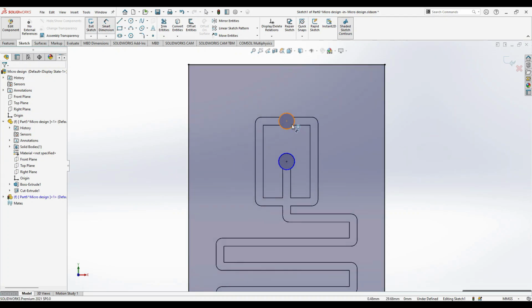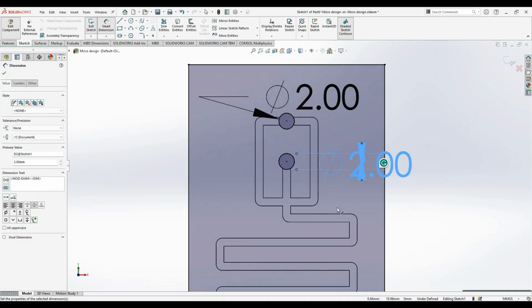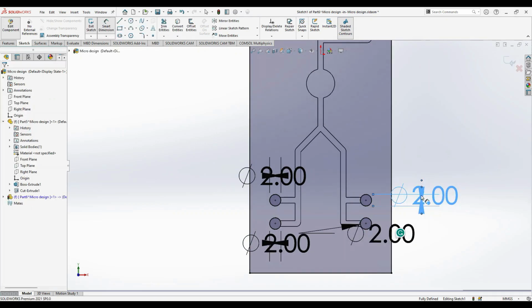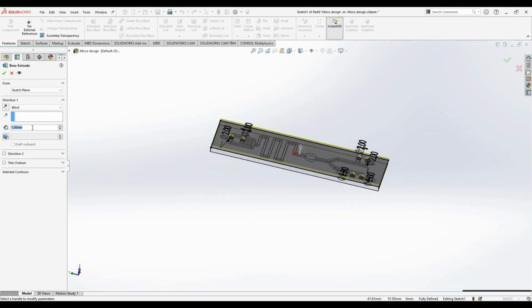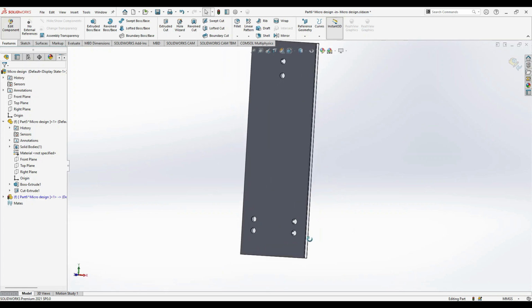Okay, since we have given a concentric, just give the dimension to it. Okay, it should be 2 mm. This is also 2 mm. Now let's try to extrude. So let's extrude a 0.5 mm sheet, a very thin sheet. Okay, and then you can see the inlets alone are open.